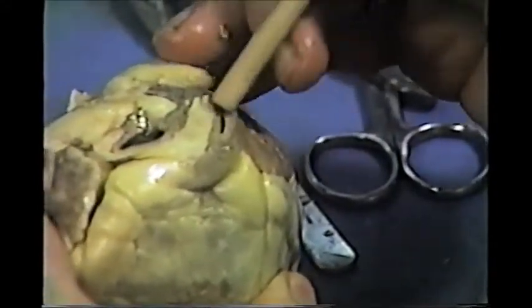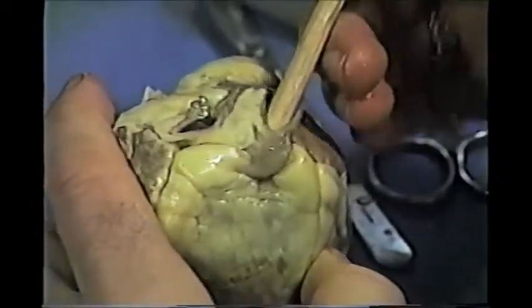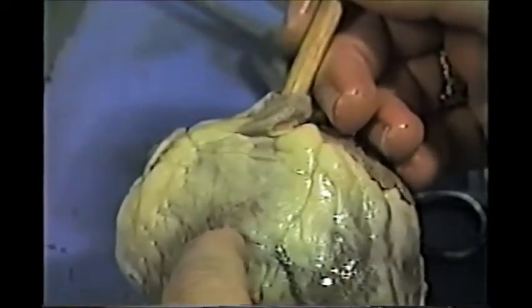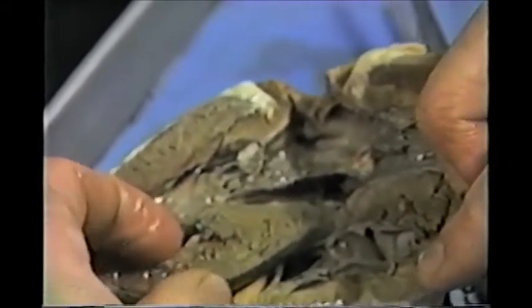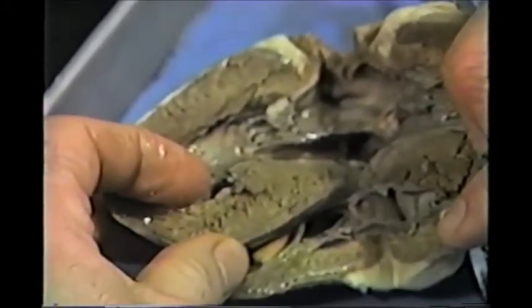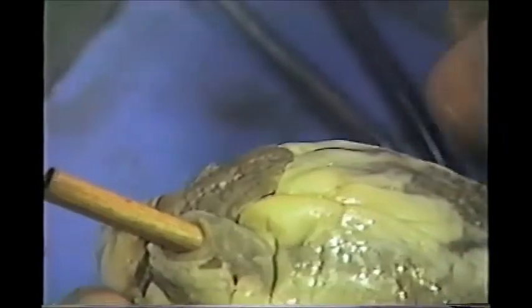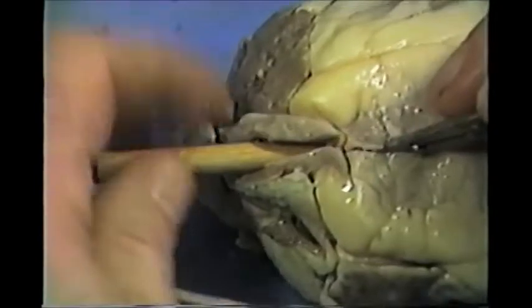I know this is the pulmonary artery, so I can stick the wooden end of the probe through the pulmonary artery and it should open up into the right ventricle right here. There's the wooden probe — we have the probe through the pulmonary artery. What I want to do now is keep the probe in place, take the scalpel or scissors, and cut open the pulmonary artery to take a look at the pulmonary semilunar valve.